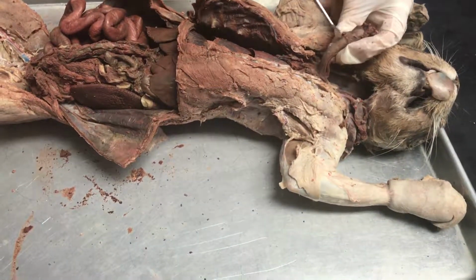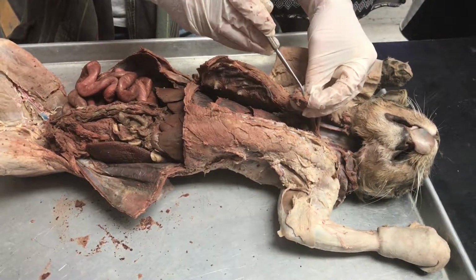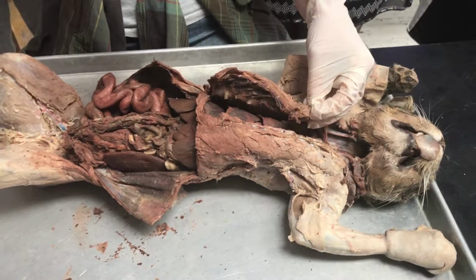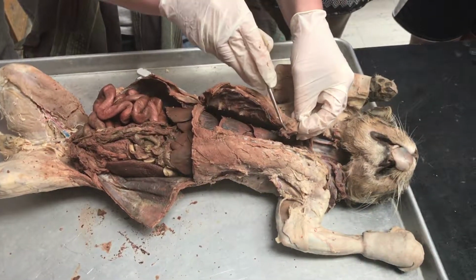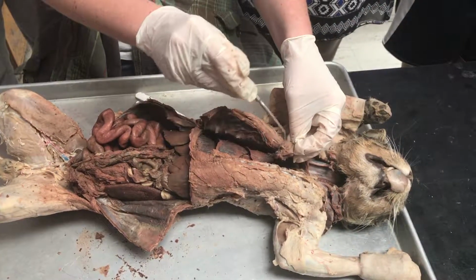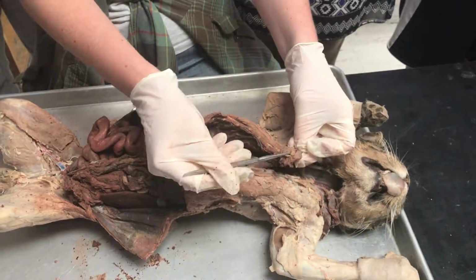So this whole structure is the larynx, or your voice box. Now you have this flap here that sort of covers the opening. This is called your epiglottis. Whenever you're chewing and eating, your epiglottis closes to cover the glottis so that food doesn't go down into your trachea. So the epiglottis is the flap, and the glottis is the hole that leads to the trachea. That's where my probe is in.